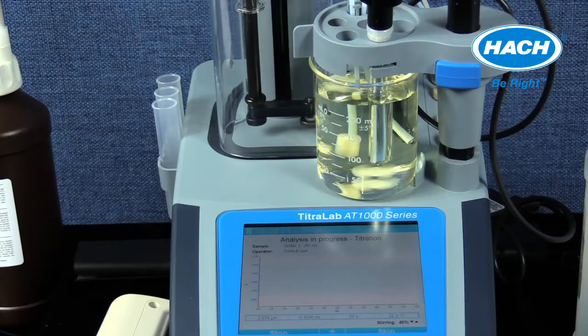The application note details the principle or theory behind this chlorine titration method. In this principle, it states that this is an amperometric titration, meaning that the titration endpoint is defined by monitoring current. This titration method is looking for an equivalence or endpoint where the current is steady and no longer changing. This graph is displaying a pattern of dropping current over time as titrant volume is added to the sample. The chemical explanation of this graph is the following.